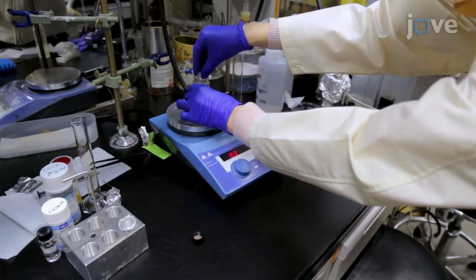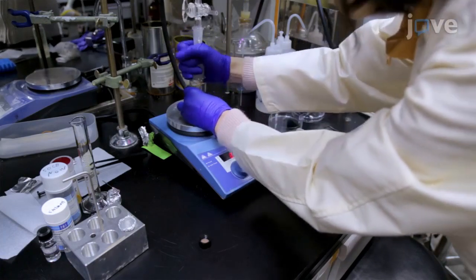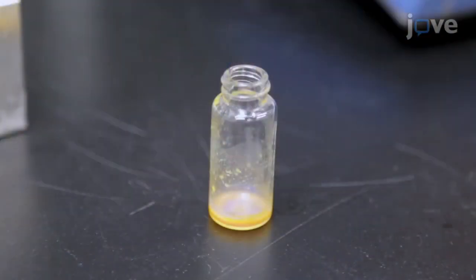Put the vial under vacuum and continue heating it for another hour to remove the remaining DCM to obtain a clear orange liquid crystal mixture.